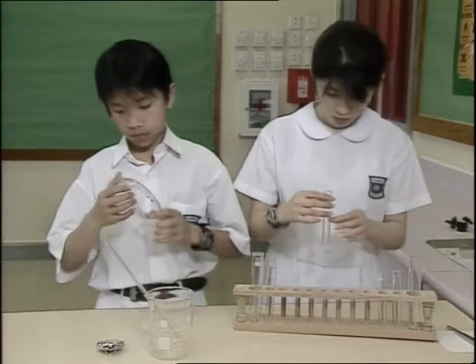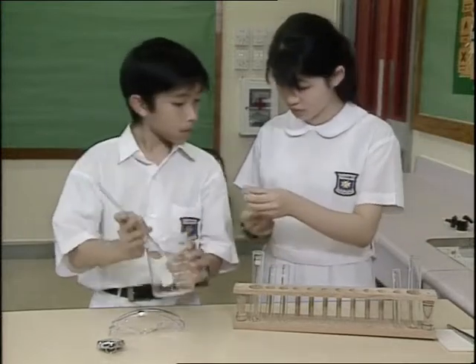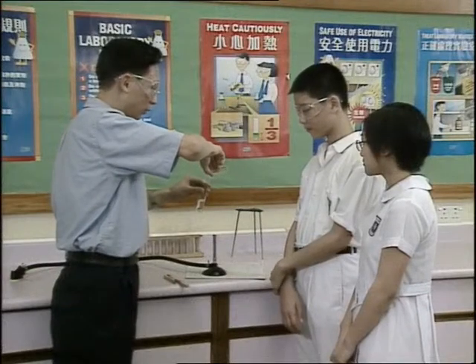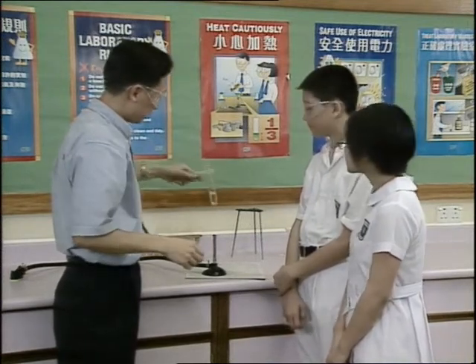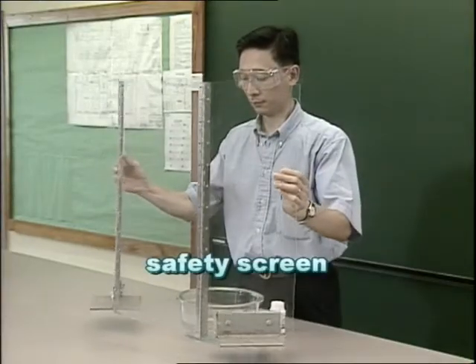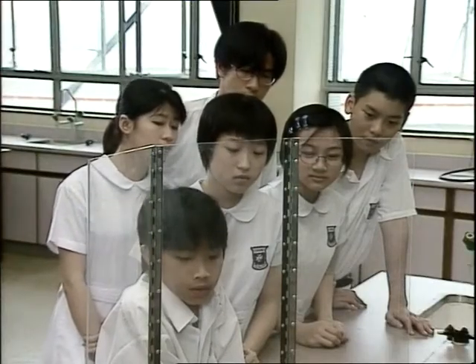Check carefully against cracks and leaks in the apparatus. Learn the right way to use the apparatus and the correct laboratory skills, such as how to heat liquid inside a boiling tube. Besides wearing goggles to protect the eyes, this safety screen can be used to provide protection for the whole body, and it should be used when an experiment is performed in front of the class.